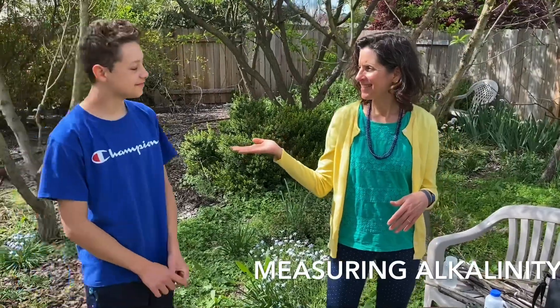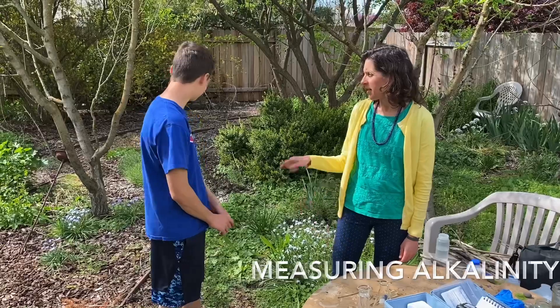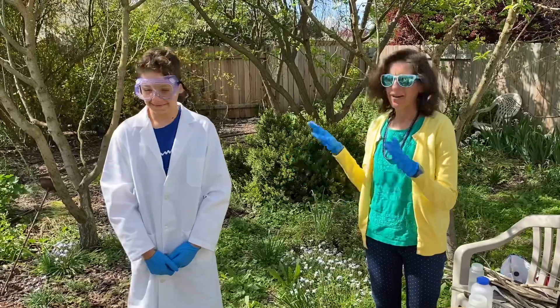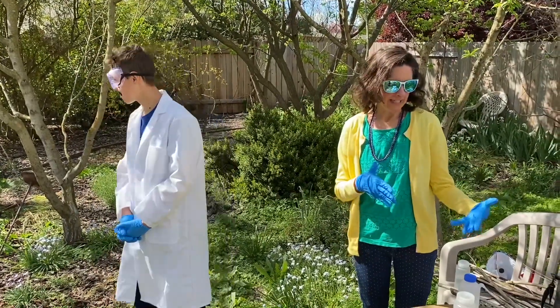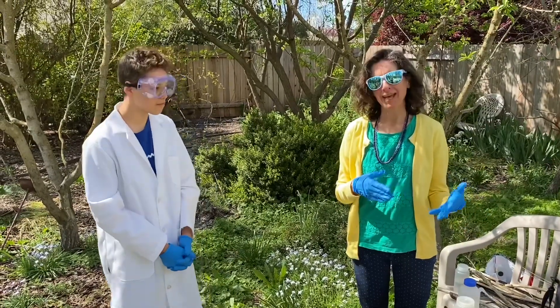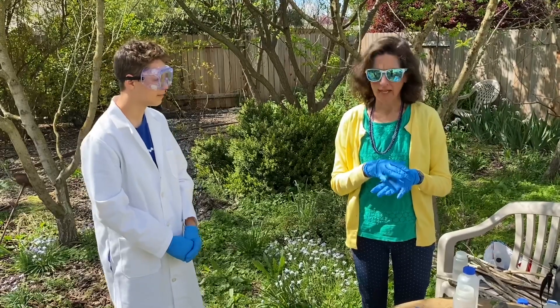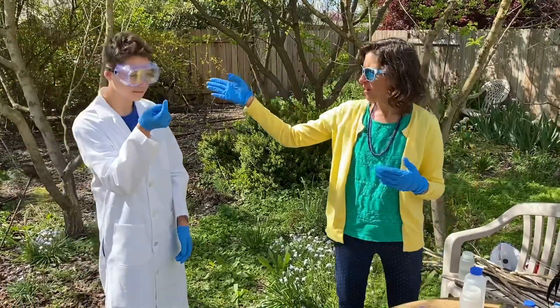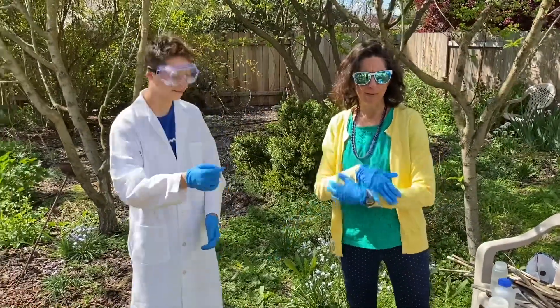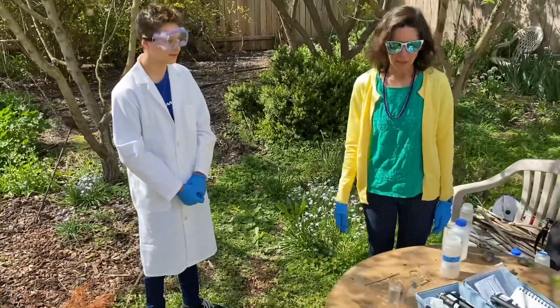I've got my assistant here today to help me, but you are just not looking like you're ready for this — you've got to go change, Eli. All right, that's much better, and I've got my gloves on too. When we do the alkalinity test, we're going to be using some acids that are fairly strong, and if they do get on your skin they can be kind of irritating, and if they got in our eyes that could be dangerous. So Eli now has his goggles, he's got his long sleeves, long pants, and closed-toed shoes. So we're ready to go.